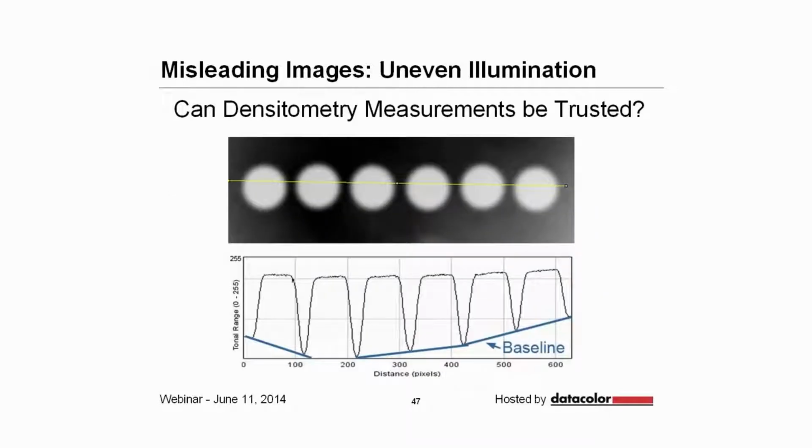And then there are issues with uneven illumination. You'd have to look at this image a little bit carefully, but you can see that there are 6 spots which actually are all of equal brightness. And in the background it's a little less dark at the edges and a little darker in the center. If you draw a line profile across that, you could potentially measure this incorrectly because you would think, oh, I should measure along the baseline. And if you measure along the baseline, you're going to end up getting erroneous readings.